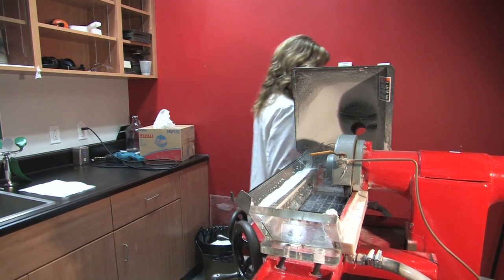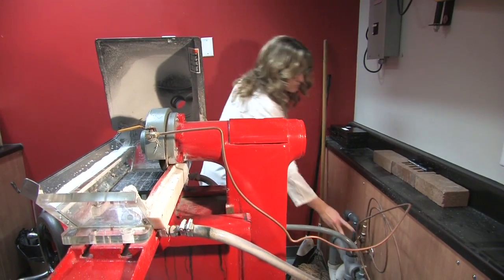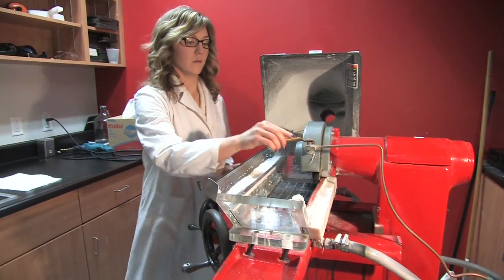Next, turn on the main water supply and adjust the flow. Ideally, you'll want just enough water to wash away the dust.